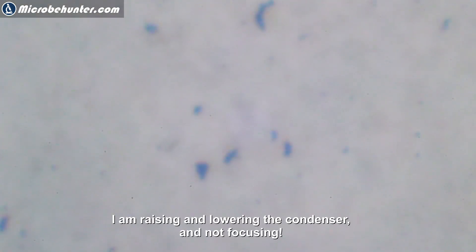I'm just going to show you what I'm doing. Even though you might not have the same microscope, maybe this little project also motivates you to have a look inside your microscope and give it a little bit of a cleaning every now and then. Looking through the microscope, I'm able to see a lot of dust and dirt, and that's really disturbing, especially when you're doing pictures or making videos. It doesn't matter at which magnification, because it's always present.